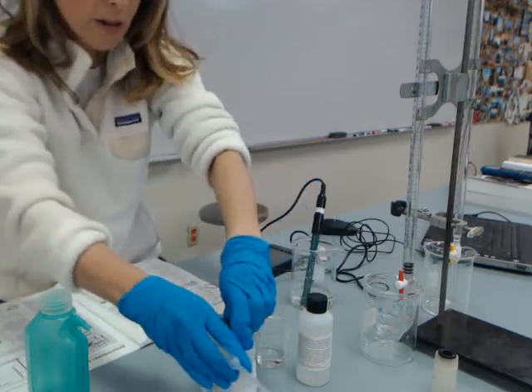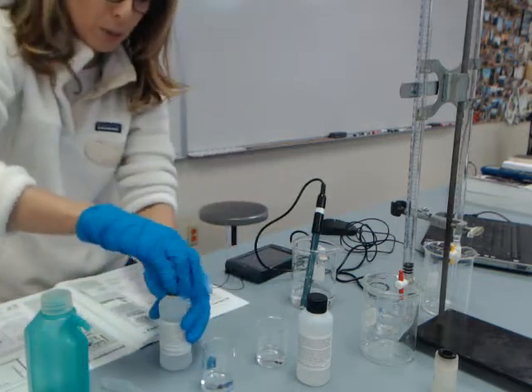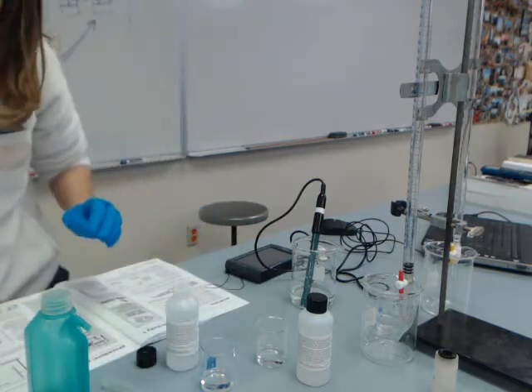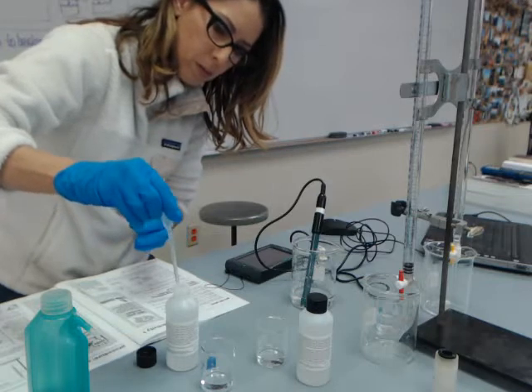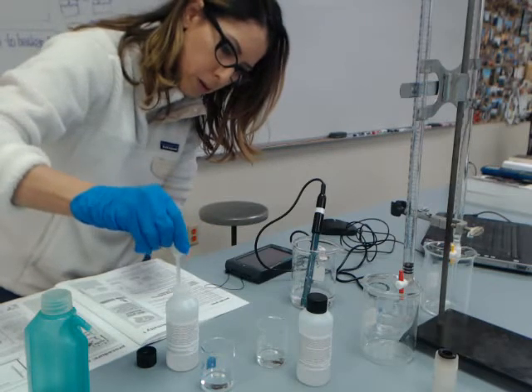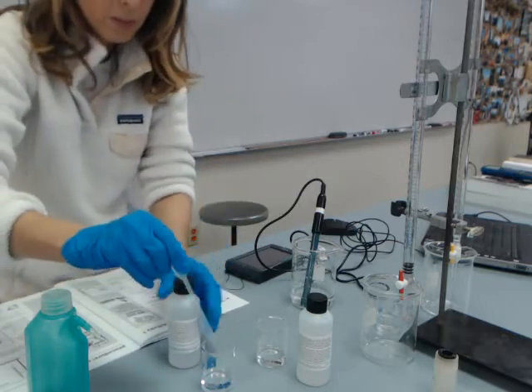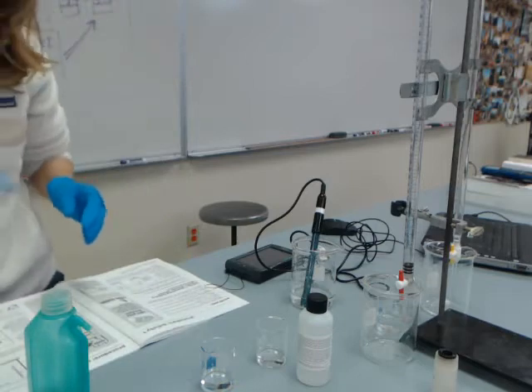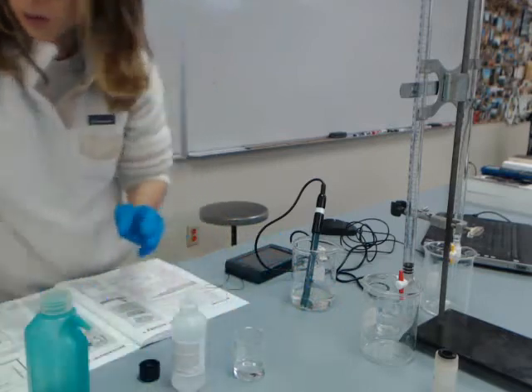For the hydrochloric acid, I'm just going to go ahead and use a disposable pipette to get myself 1.5 mils. So we're going to pull out 1.5 — there's my HCl — and then I'm going to pull out 1.5 of sodium hydroxide.